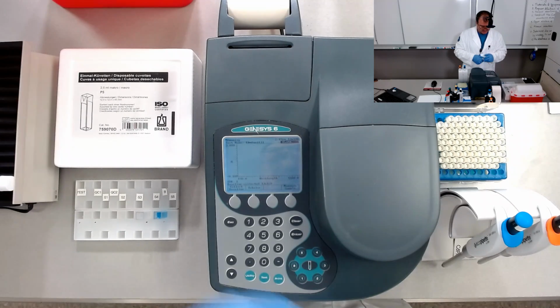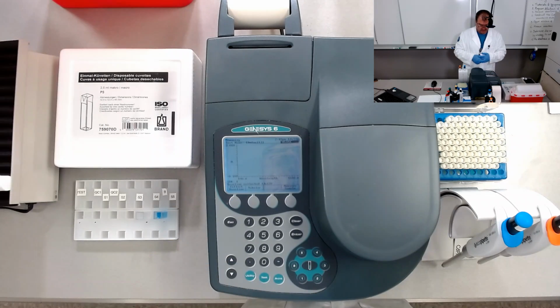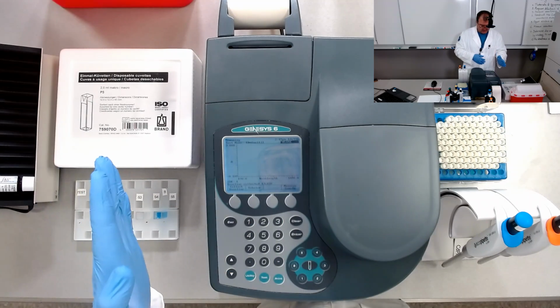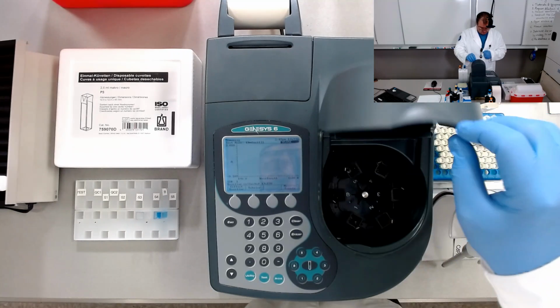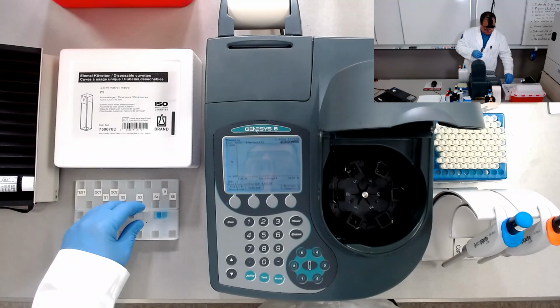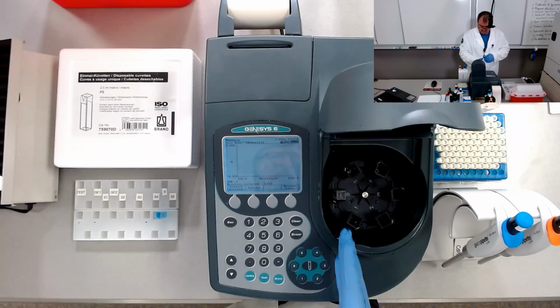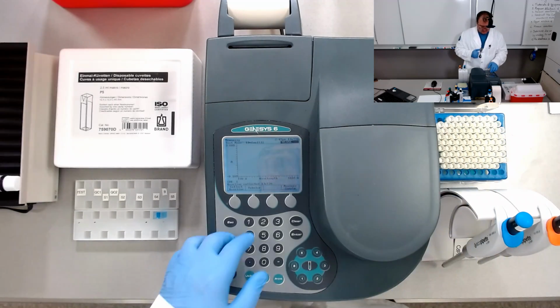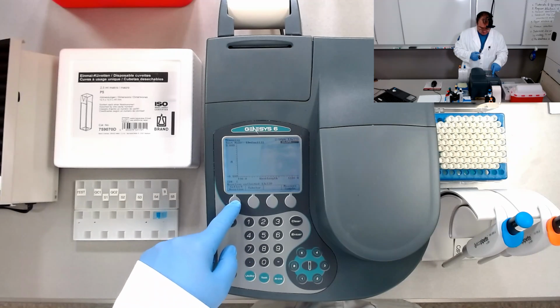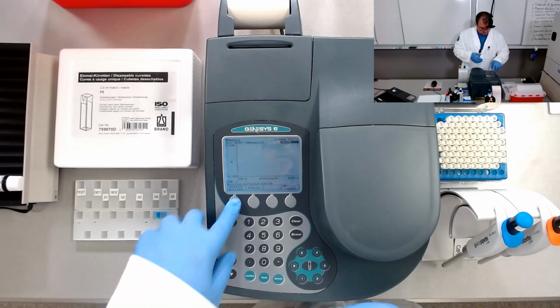It now requires us to collect the baseline, meaning that we'll get the blanking for the whole range of wavelengths from 190 to 1100 nanometers. So it requires the blank. Position the blank in there. We take the cuvette and place it in the blanking position here. The light beam comes this way. Okay, blank, collect the baseline.